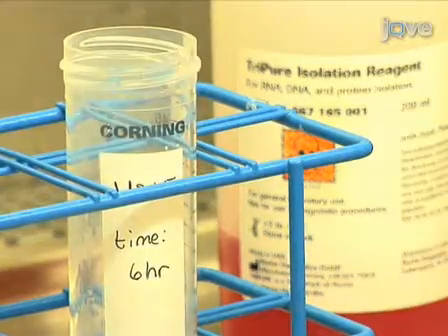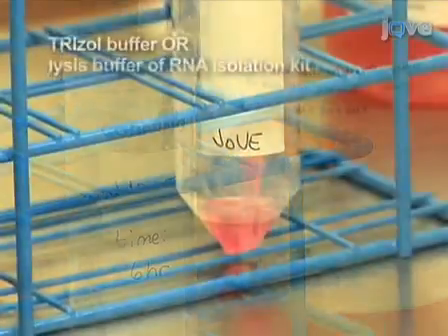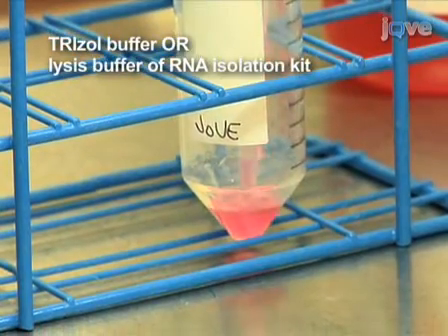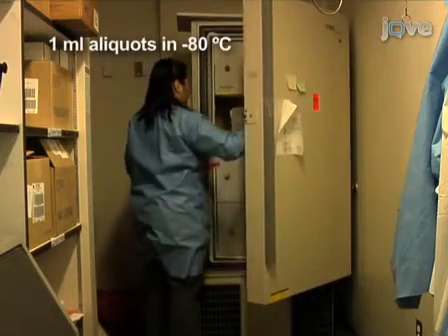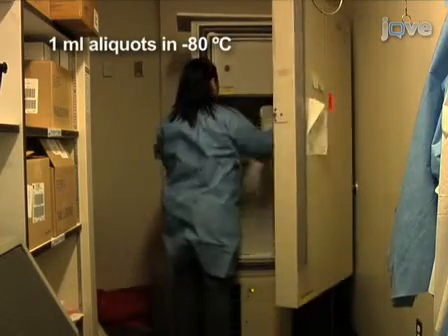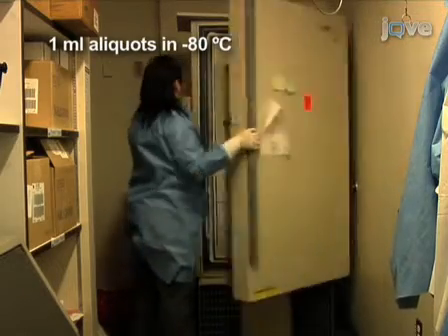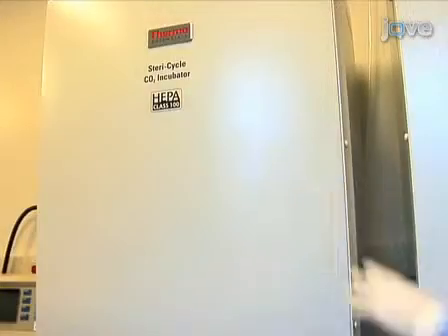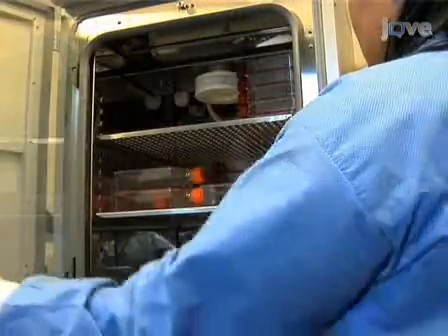Resuspend the cell pellet in either Trizol reagent or the lysis buffer from your desired RNA isolation kit. If you are using Trizol, divide the sample into 1 milliliter aliquots in 1.5 milliliter labeled Eppendorf tubes and freeze at -80 degrees Celsius. Repeat for all time points, harvesting 1 flask per time point.